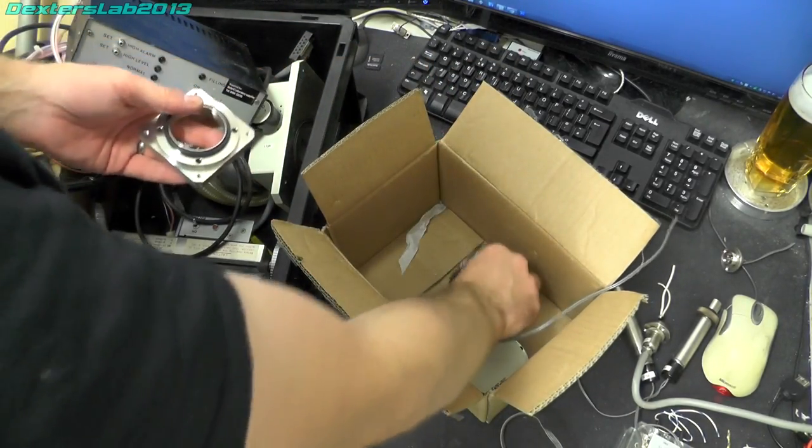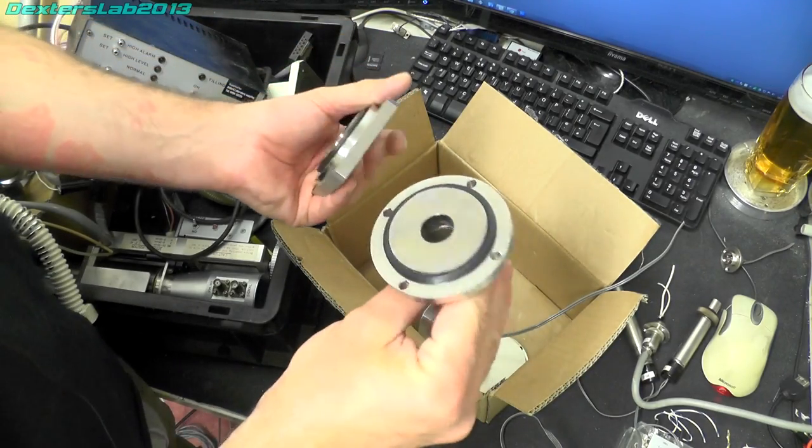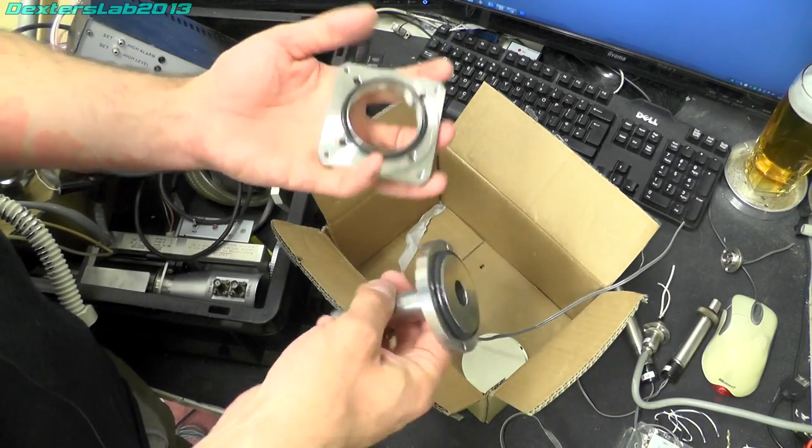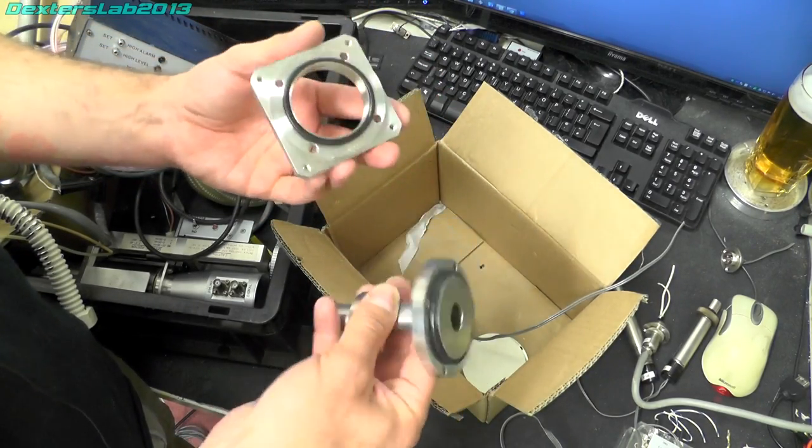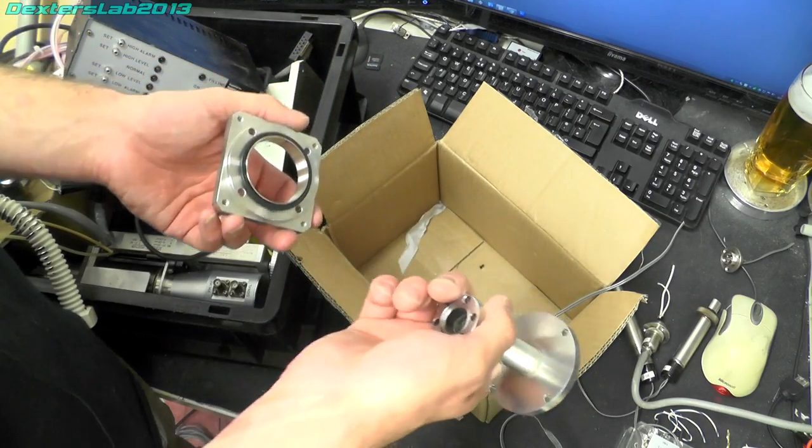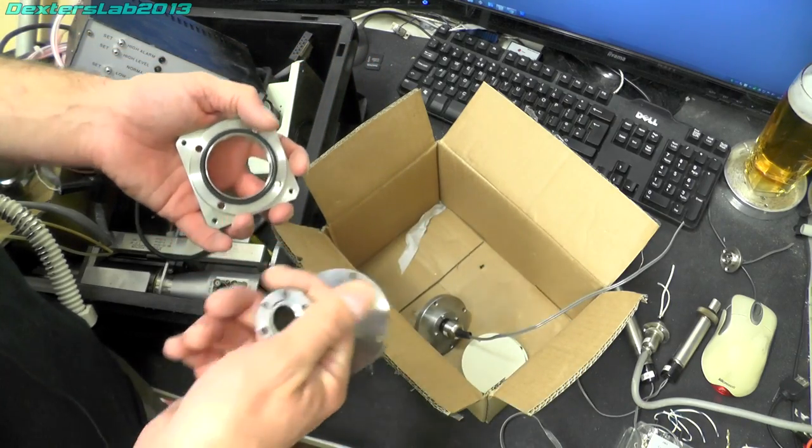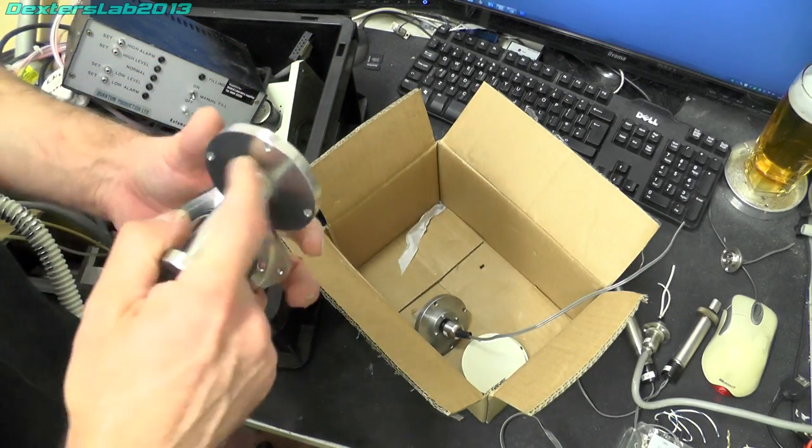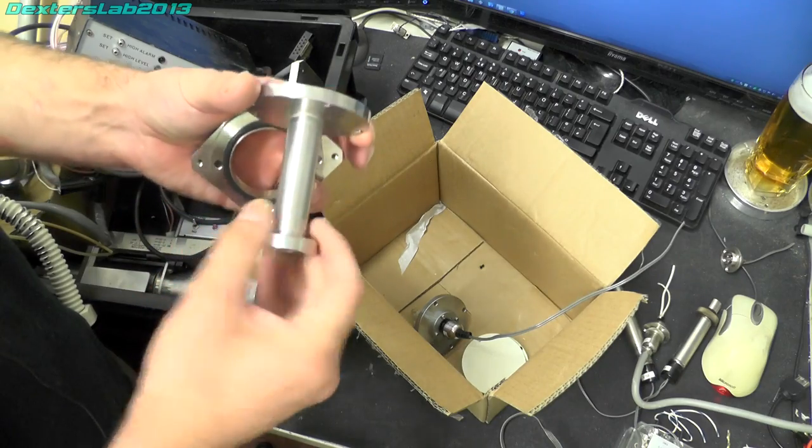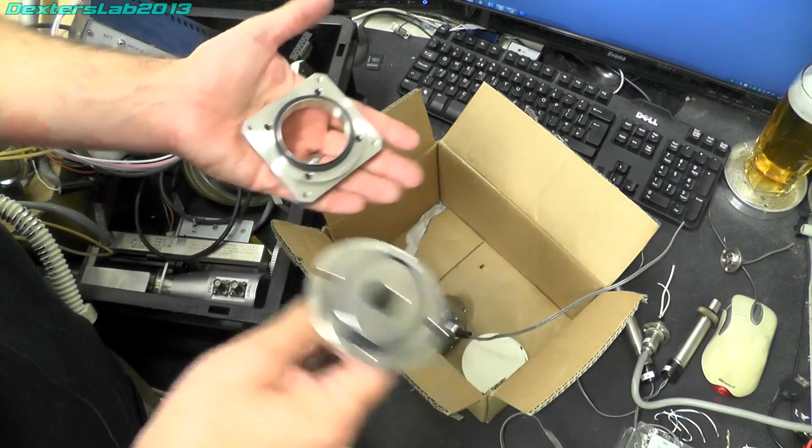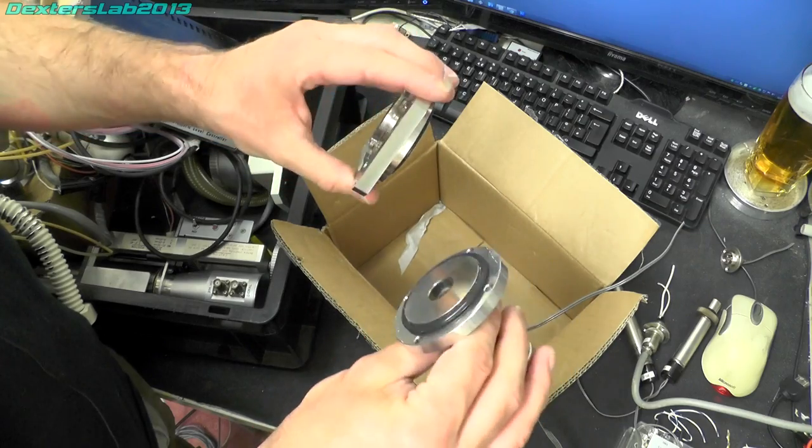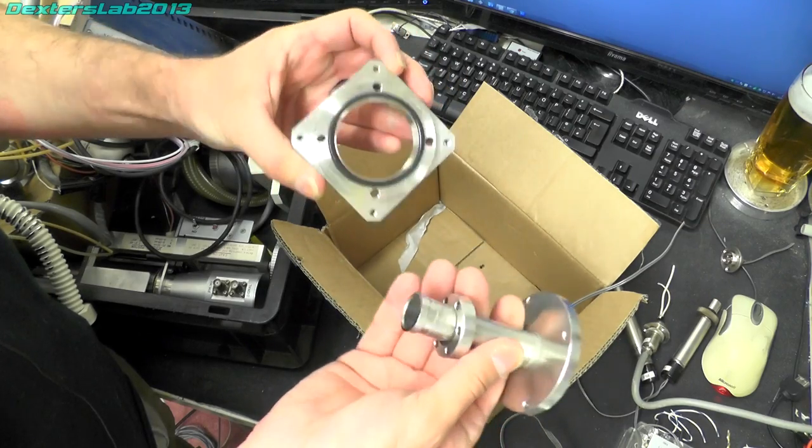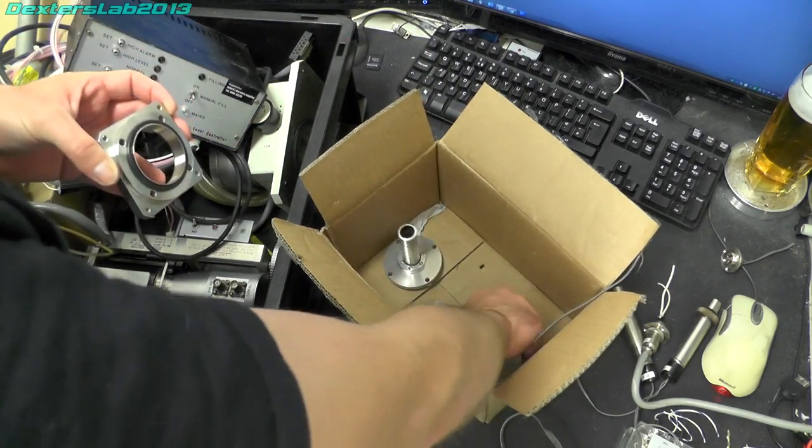And the rest of the items in this box are all adapters that mate up to the sample chamber. There's a guy who has contacted me who has an identical machine to this one and he needs some spares for his so these will make really handy things for him to have.